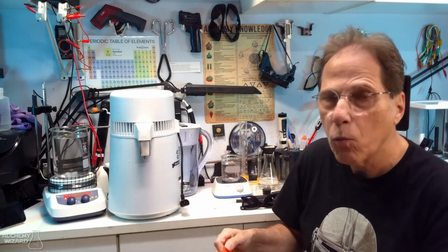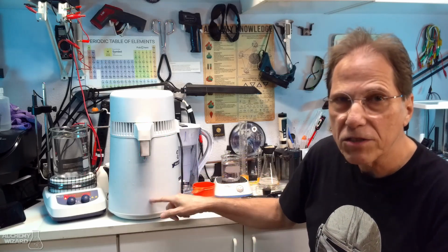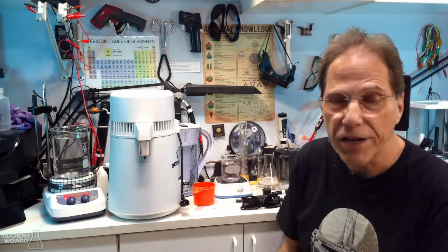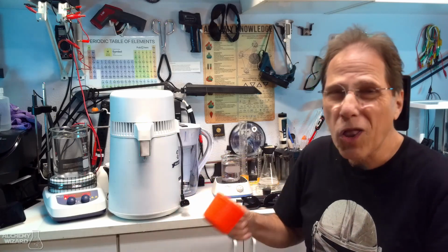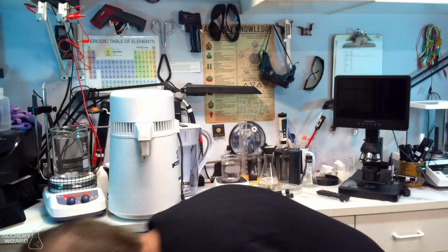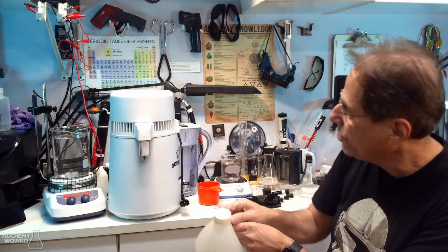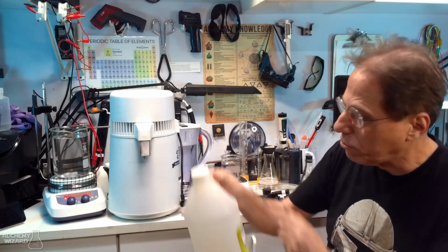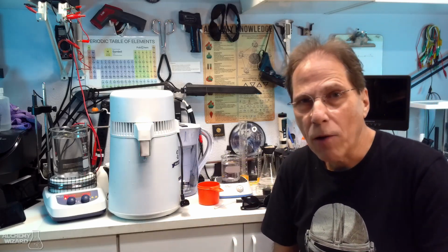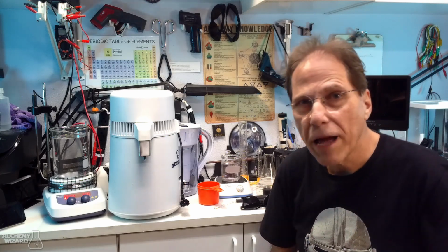Then I will dump that water out. I will see how much of the crap I've gotten off the bottom of the distiller. And if the stuff still remains on the bottom of the distiller, I will do it again a second time. Now, if you've got a lot of crap on the bottom of that distiller because your tap water is really, really bad, then you're going to have to use a lot more. What you're going to have to do is fill your distiller 50% with vinegar, I know it's a lot, and then the rest with water, and cook it for another 2 hours, 2.5 hours or so. Then shut the thing off, let it cool down, and then empty it out and clean it.